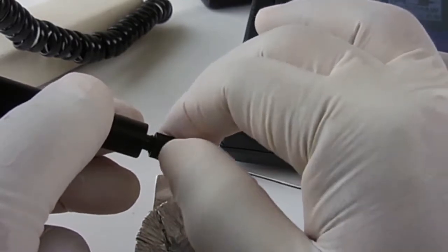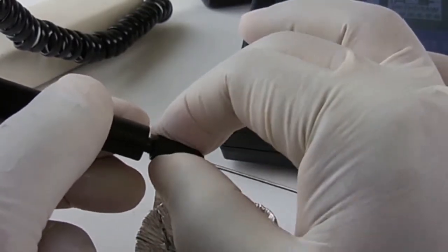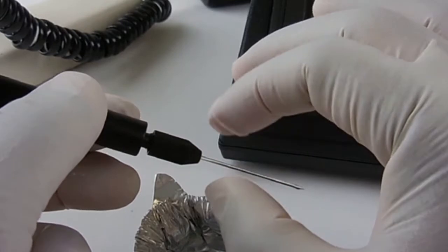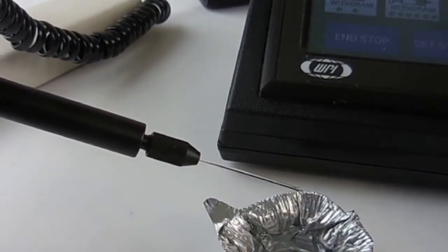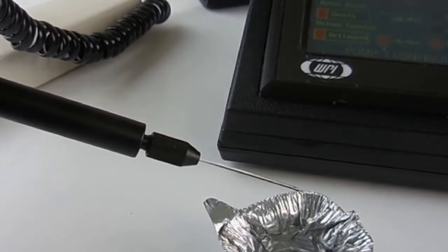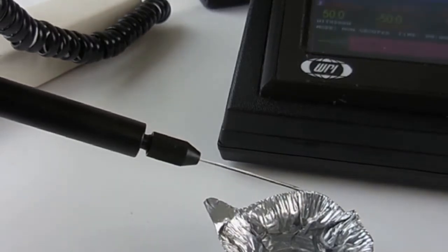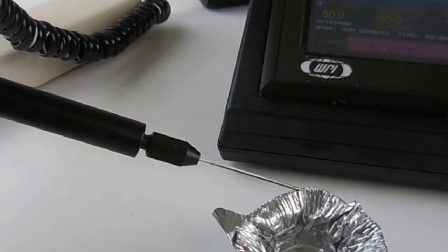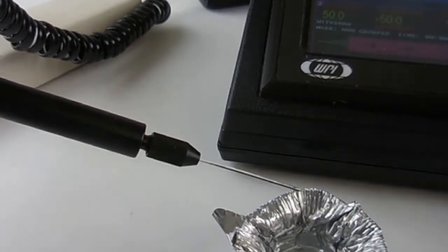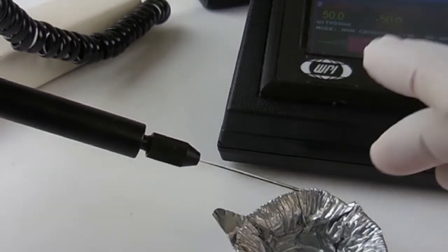In this instance, we are going to fill the micropipette with 3500 nanoliters or 3.5 microliters of the liquid I want to inject. On the smart touch controller, you set the total volume to 3500 nanoliters and hit enter. Set the flow rate at a fast speed to empty the micropipette the desired volume required.